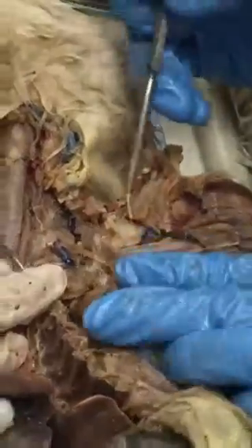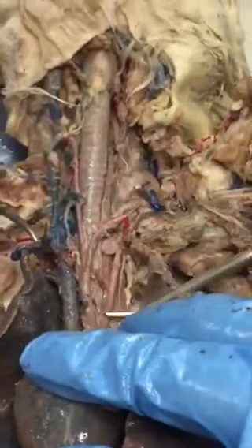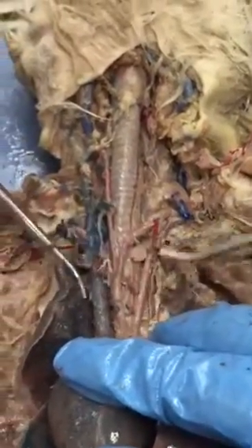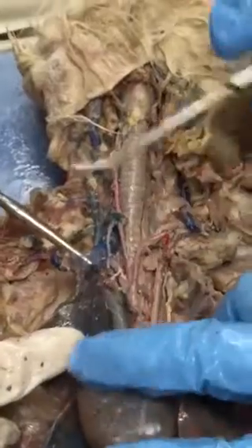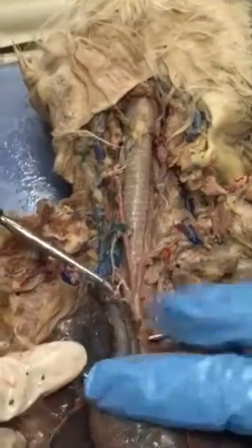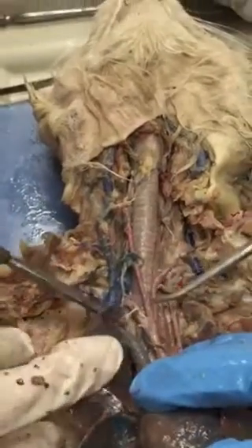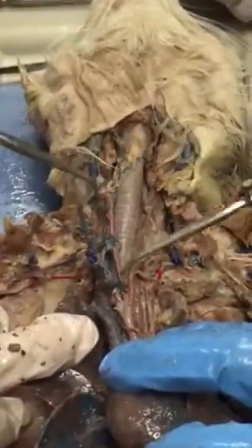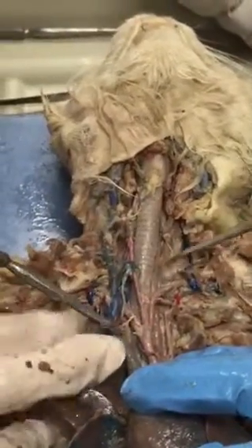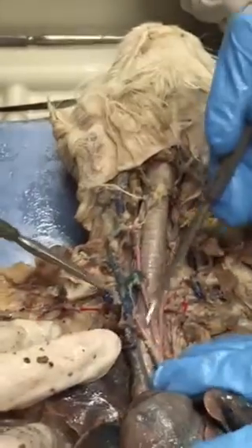All right, so coming back over here. Where was the subclavian? This is the left subclavian. The left subclavian is much longer than the right subclavian. So what is this big thing? Brachiocephalic trunk. So we do use trunk there. And then on the cat we have two branches. What is this? Right common carotid. And this is the left that goes up here. That's correct. And then over here, right subclavian.